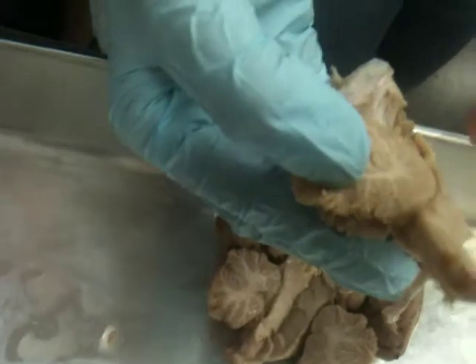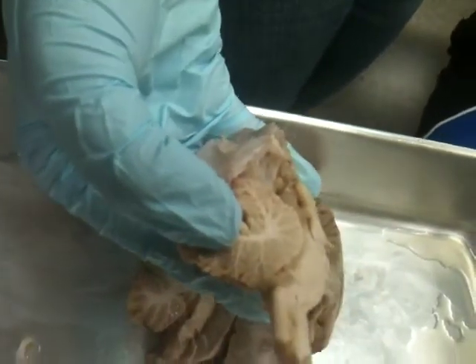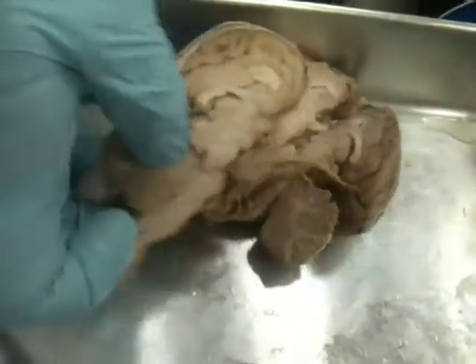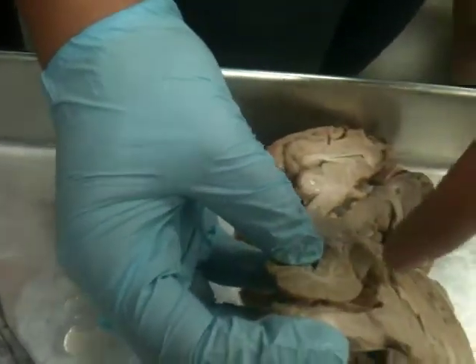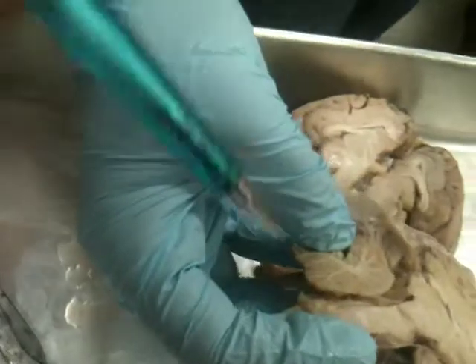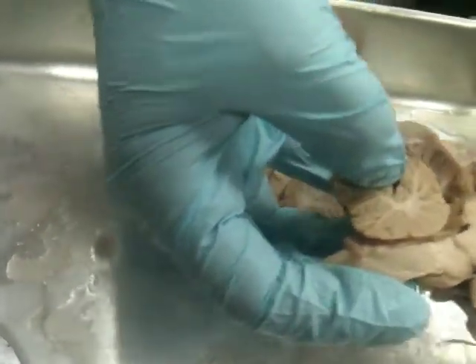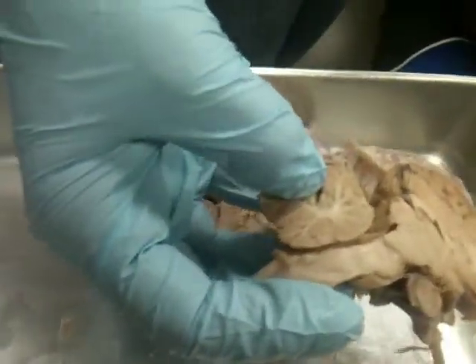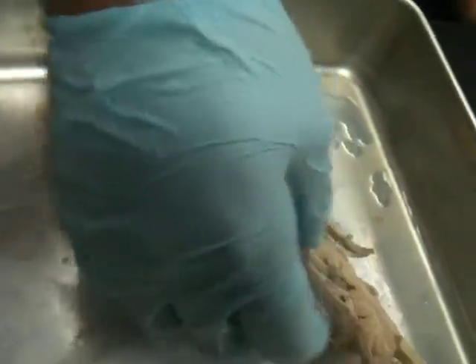You can see there's like a little bit of an indentation in there, and that's literally all it is, that little indentation. That's the third? Yeah, and then the fourth is between the cerebellum and the brainstem. So you kind of have to look in there, and again you can see there's an indentation running along there. So fourth, third, lateral? Yeah. And I'll always say name this ventricle so you guys don't get confused and think I'm just pinning the brainstem or something. Okay. So they just go from front to back, basically? Yeah.